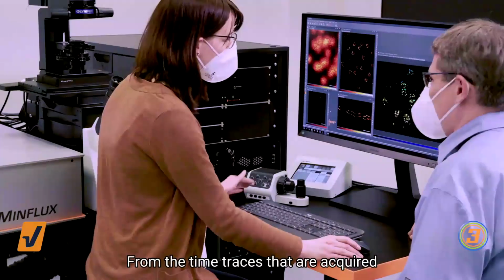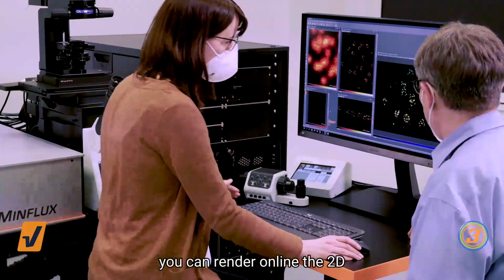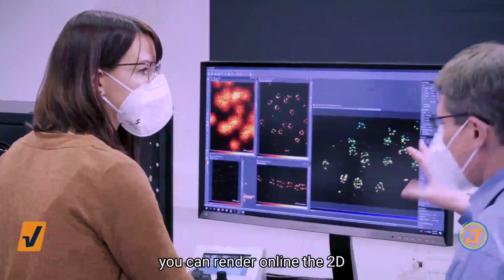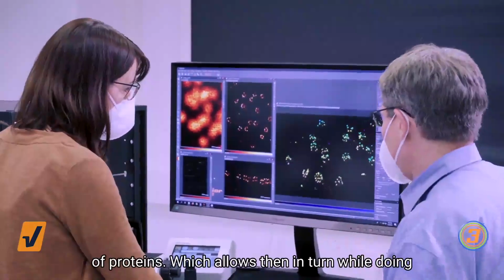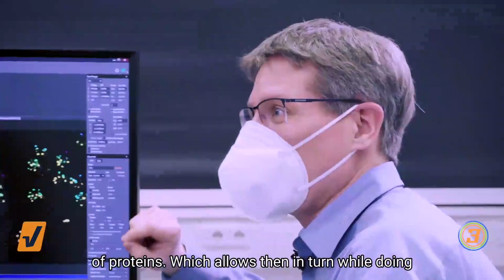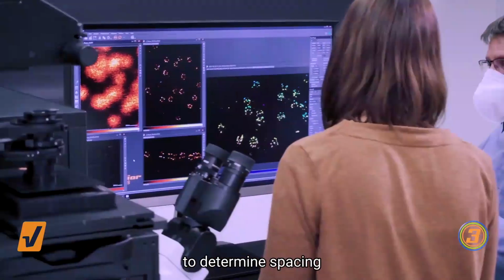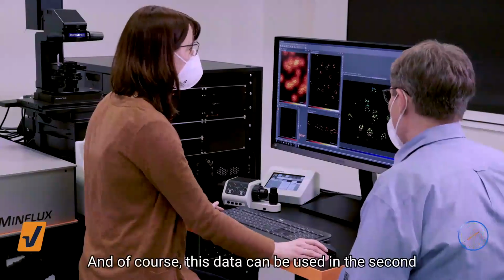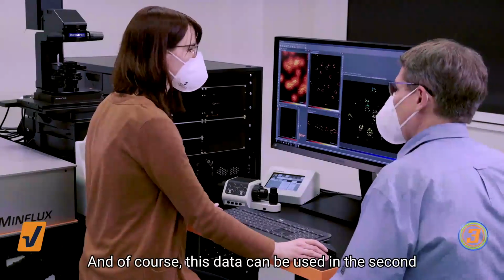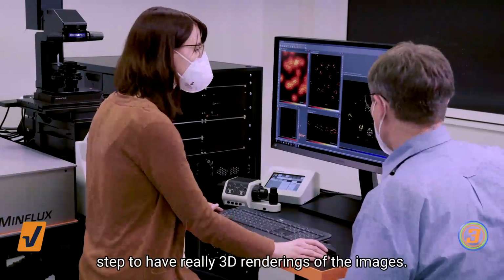From the time traces that are acquired during the image acquisition, you can render online the 2D distribution of proteins or the 3D distribution of proteins, which allows then in turn, while doing the acquisition directly, to measure distances to determine spacing of individual proteins in the image. And of course, this data can be used in a second step to have really 3D renderings of the images.